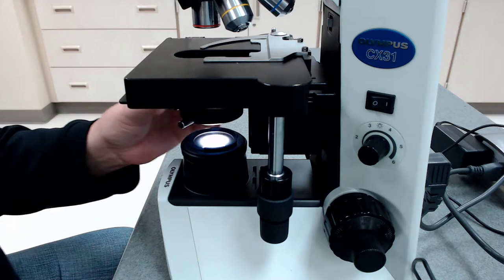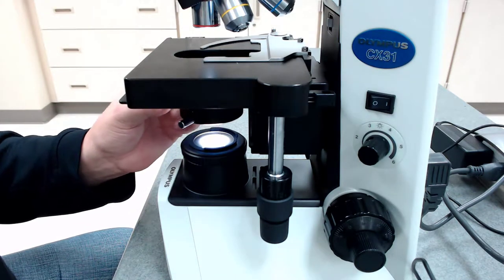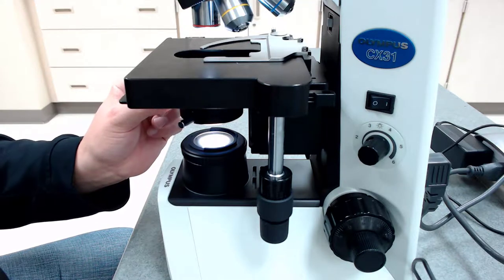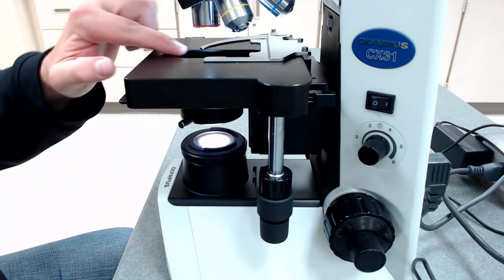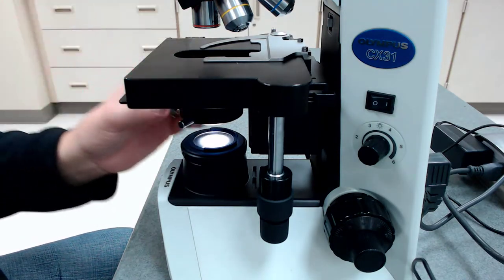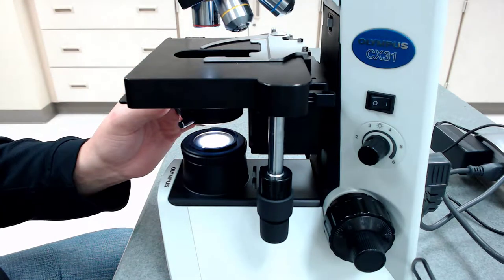Other structures you'll have a harder time seeing here in this video, but I'm using a little teeny metal handle here that I call the iris diaphragm. And hopefully you'll notice that as I go to the left, more light's coming through the condenser here. As I close it down, less light is going through the condenser. So that's another way to control light intensity.